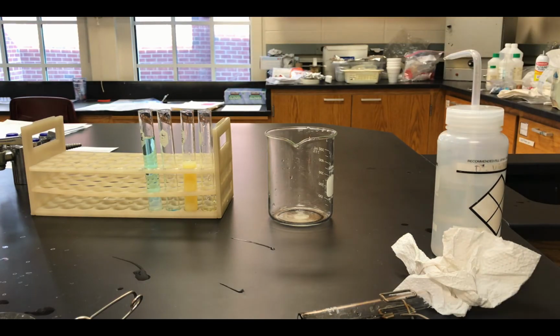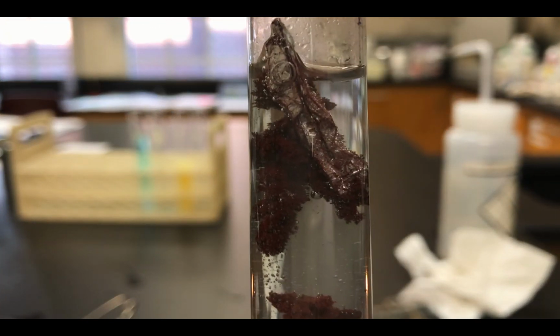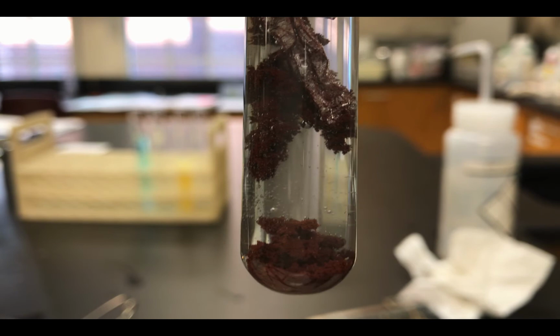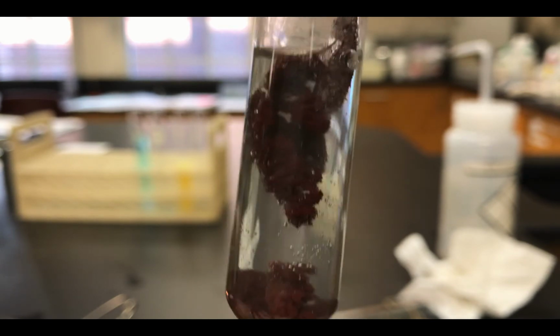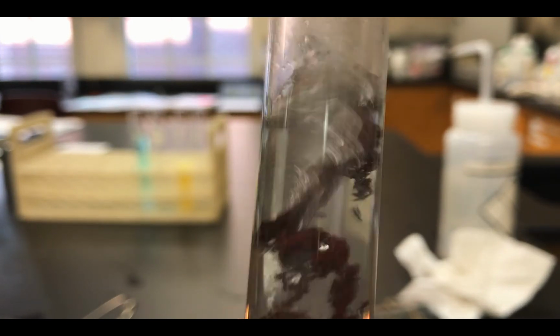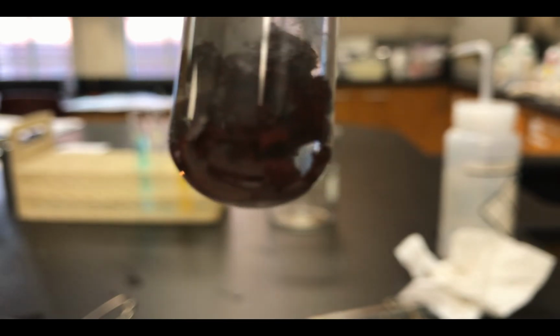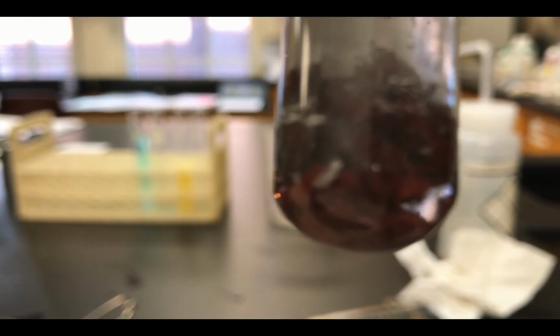Here is another visit to demo number 1 with the aluminum in the aqueous copper chloride. And so you'll see that it is again different as we give it more time to sit. And as we agitate the tube, we should be able to take note of a few other things. And make sure you get some good observations. You will need them later.